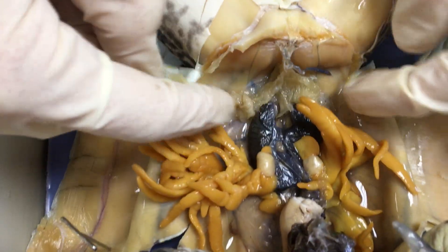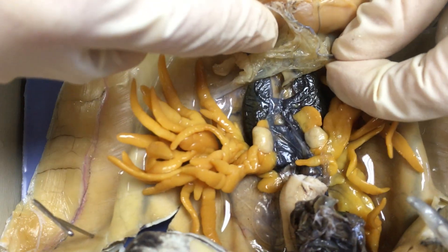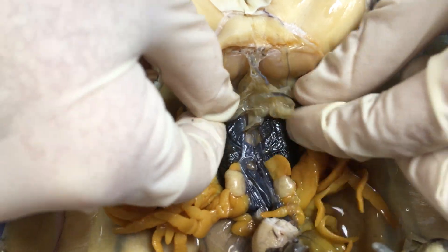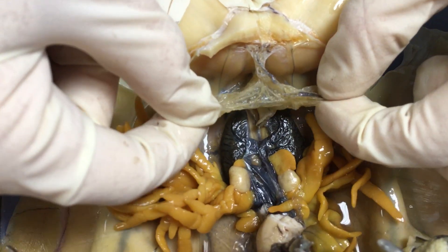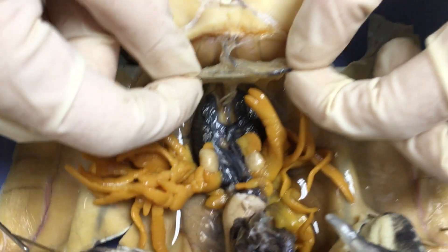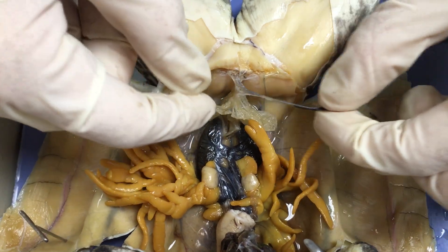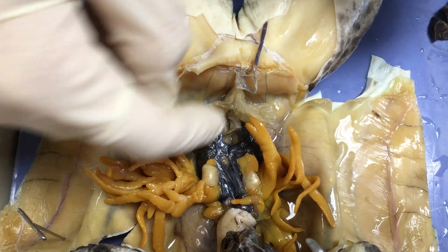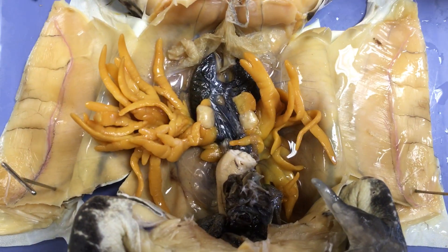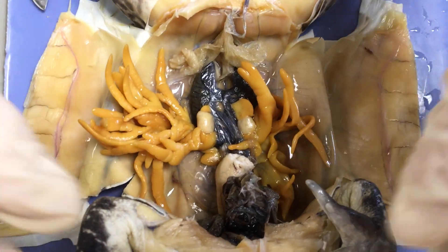This last structure right here is the urinary bladder, which the kidneys are connected to — it stores urine before it exits out of the cloaca. Similar to the lungs, but obviously in a very different location, this deflated balloon-looking structure is the urinary bladder.